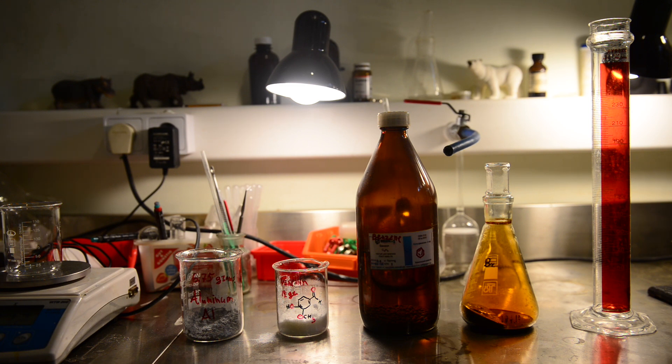Today on the table I have the following reactants. Aluminum powder 6.75 grams. As it is mentioned in the patent the finest powder you can get the better. From our distant friend I have got pyrophoric grade powder. 19 grams of vanillin, 60 grams of bromine and benzene.